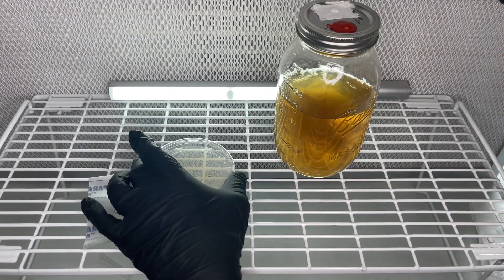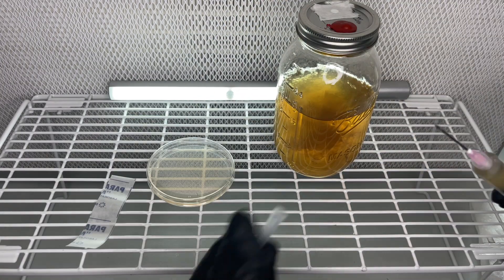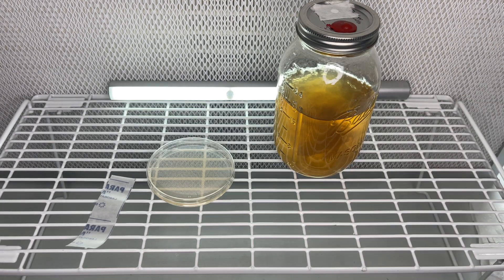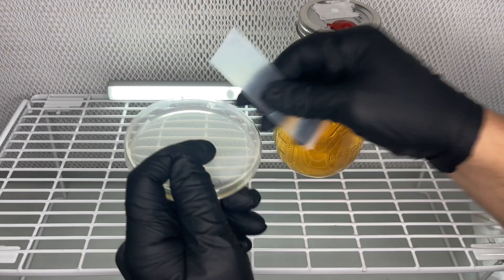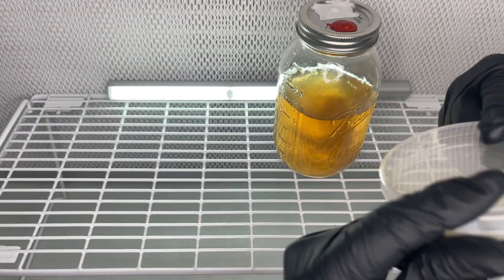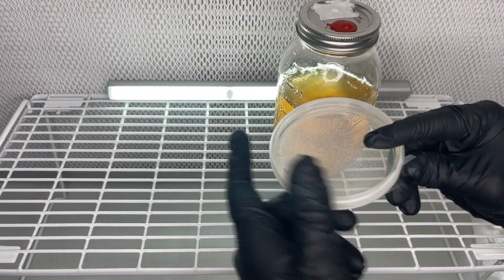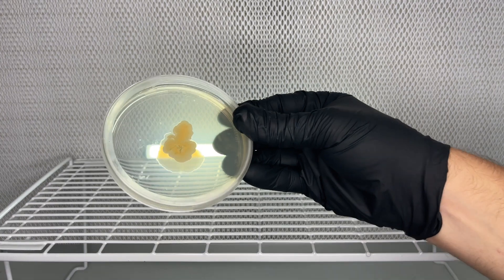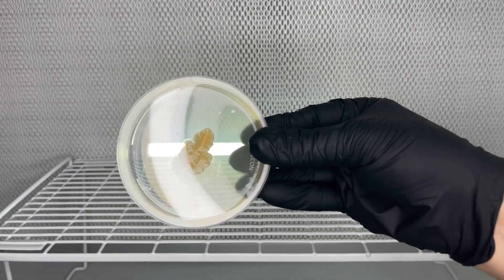The jar of liquid culture that I'm using in this example I already know is super contaminated. After only a couple days, I can already see the contamination with no sign of mycelium that we would normally be able to isolate away from the contamination and save.